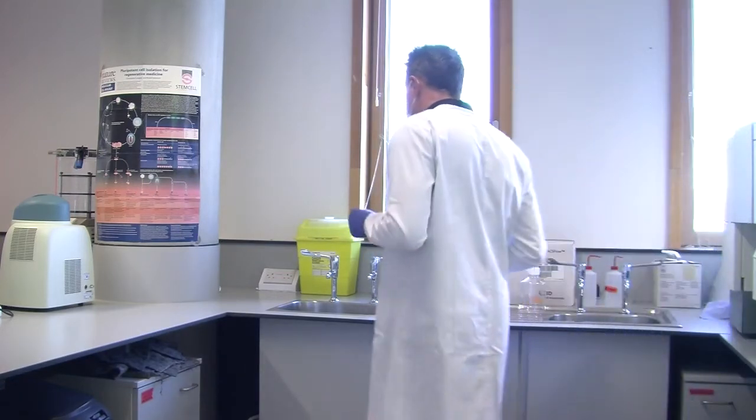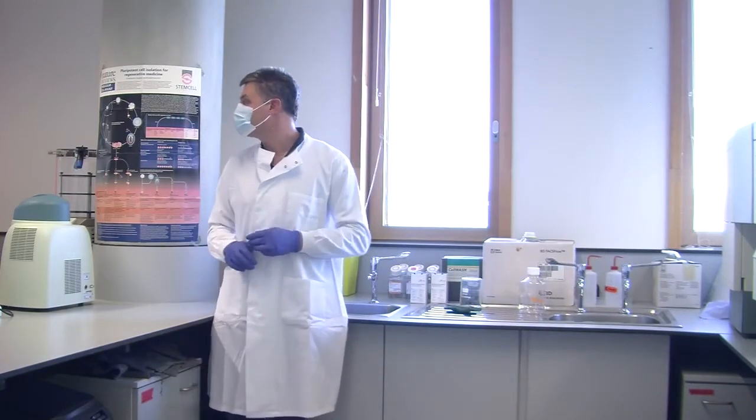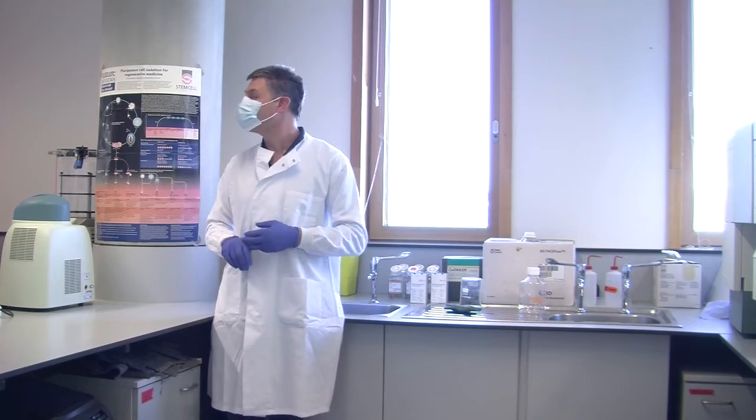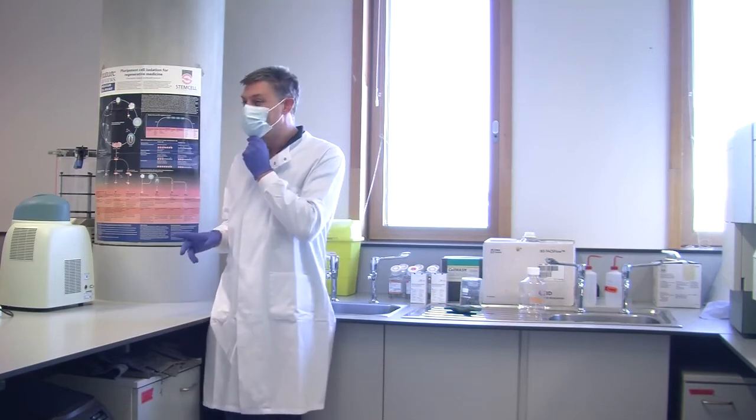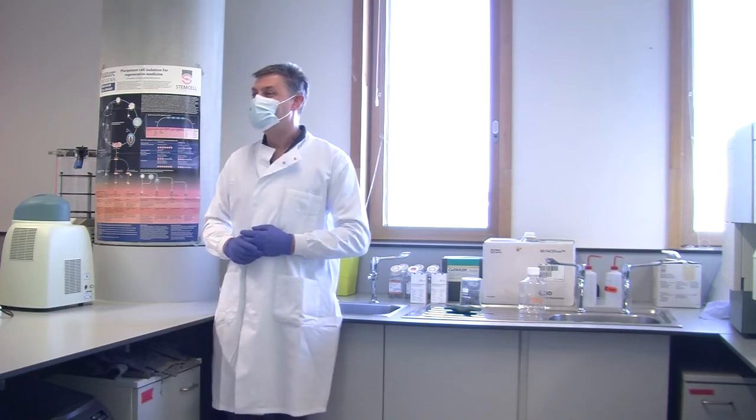So when you come in and you find your 3 really expensive antibodies in a rack on the windowsill in clear tubes, you tend to get a bit cross. That's not a mistake. That's being stupid.